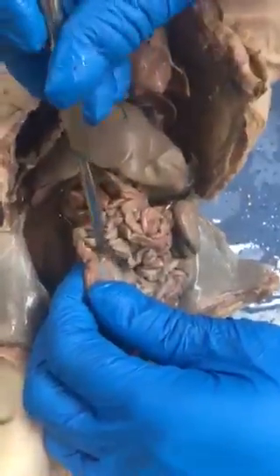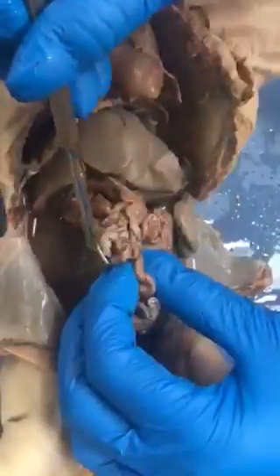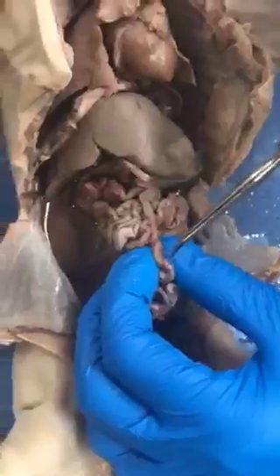And anywhere along here, this is one of my favorite things. If you pull this out, you can see the mesentery proper. So a mesentery, the lesser omentum and the mesentery proper are both mesenteries. So you have visceral peritoneum connected to the abdominal wall in the back. It comes away from the abdominal wall, wraps around the tube of the small intestine, and goes back to the abdominal wall on the other side. So on the small intestine, there's one layer, that's the visceral peritoneum on the organ.